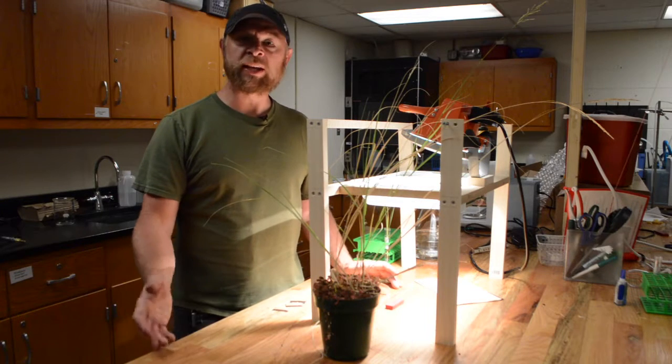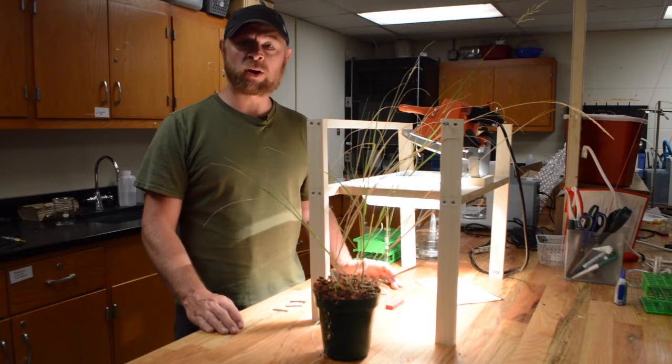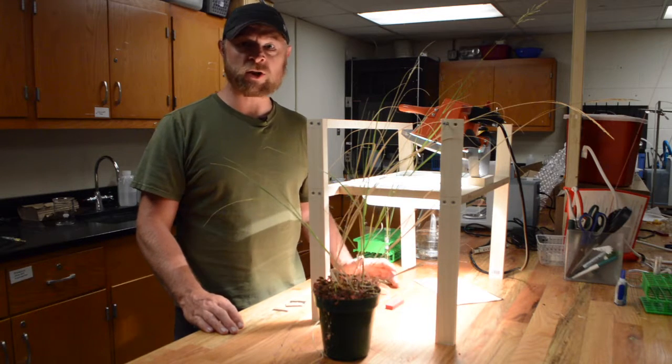Hi, I'm Troy Ockletree. I'm a plant ecophysiologist at Colorado State University, and I'm going to walk you through one of the methods we use to measure leaf hydraulic conductance.